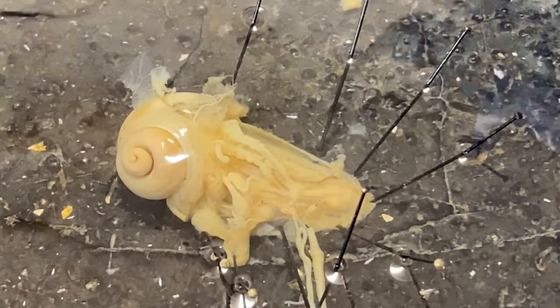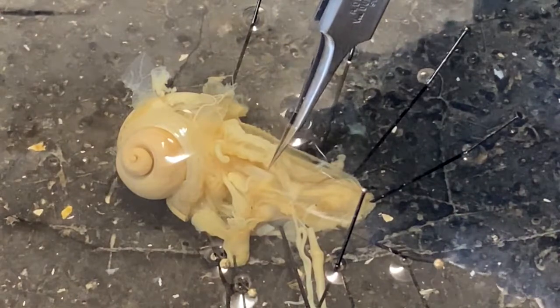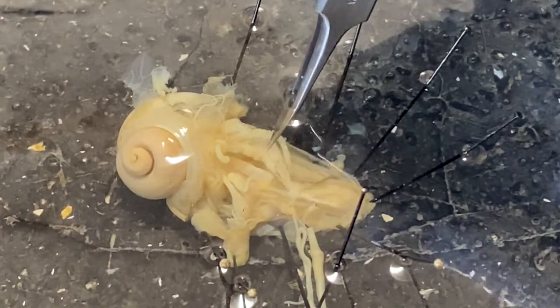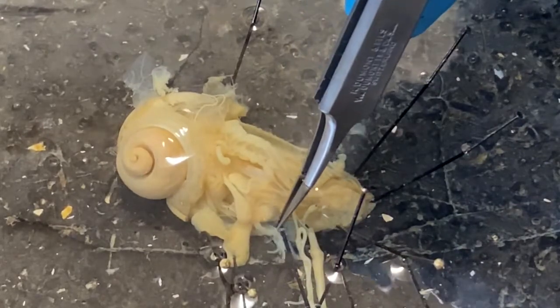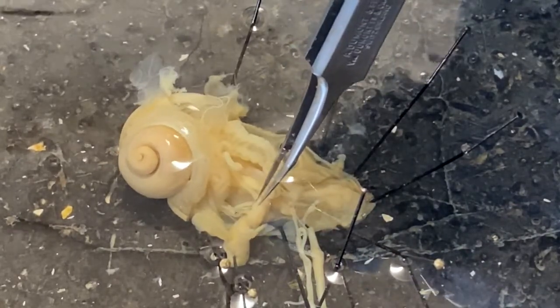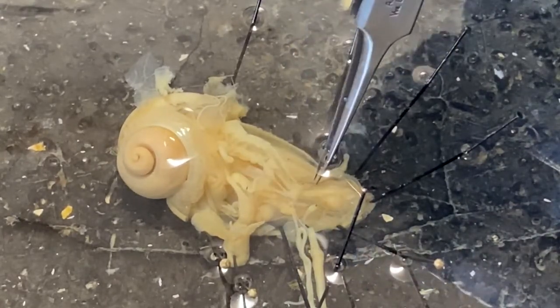And that is a walk through the internal anatomy of Helix. It's really easy to turn one of these into what we'd call a dissection bomb crater, but this one was pretty cooperative in terms of what we were able to see.